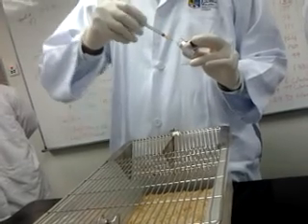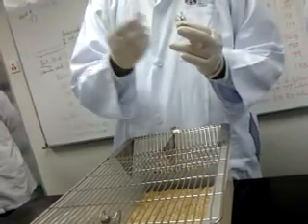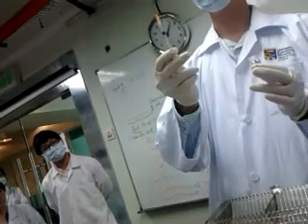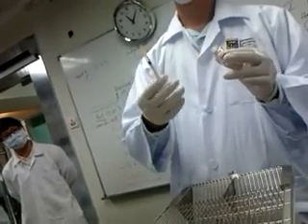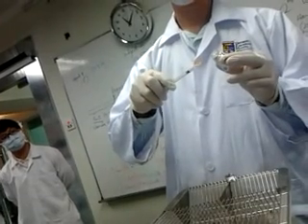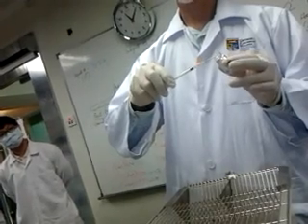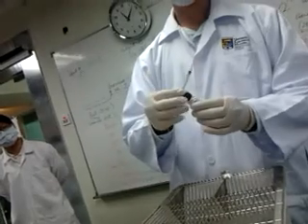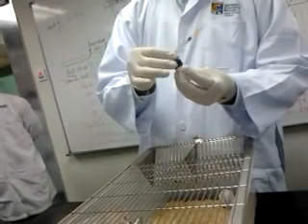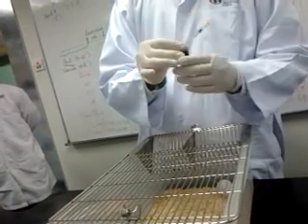But you see, absorption is very slow. You need to get it. And this drug is light sensitive, so it doesn't last very long. So we give 0.1 ml per 50 gram. Because it is subcutaneous, they break down the drugs, so I have to give more than the body weight. Mouse and rat are different types of animals, their breakdown is different. Mouse breaks down drugs very fast, so you have to give extra.